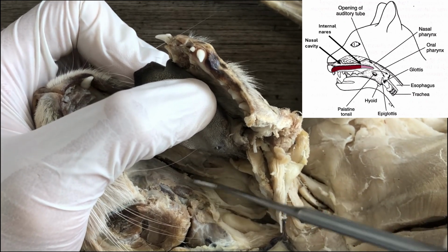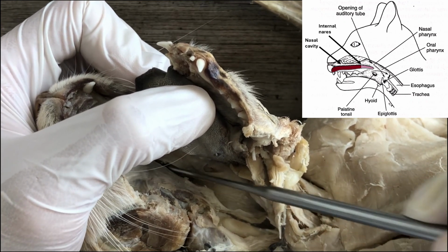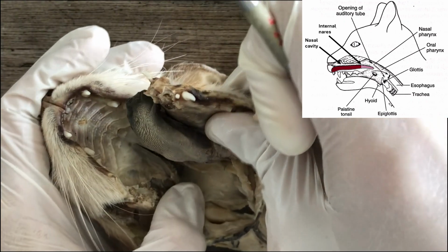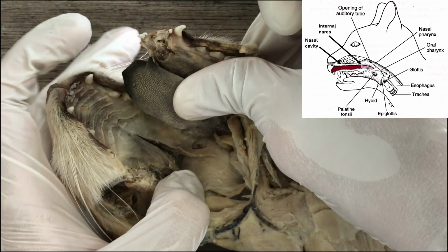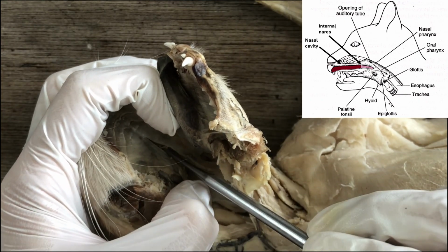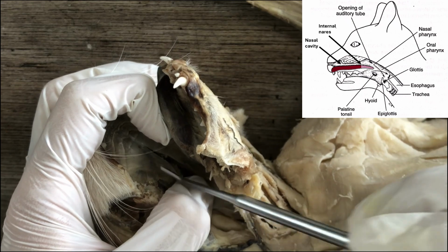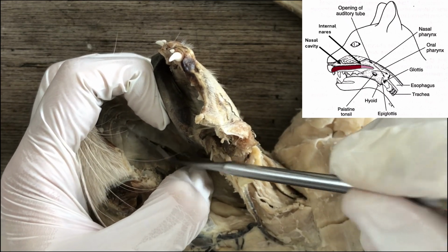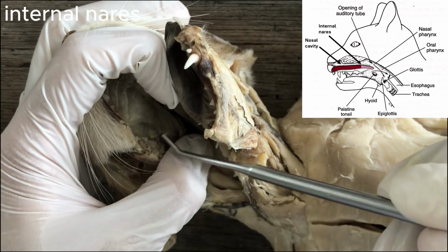And this is the soft palate, which I have already incised in order to view the nasopharynx inside. If you trace the pharynx anteriorly, you will eventually reach the internal nares, right?